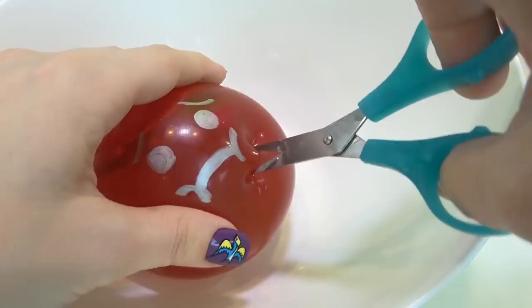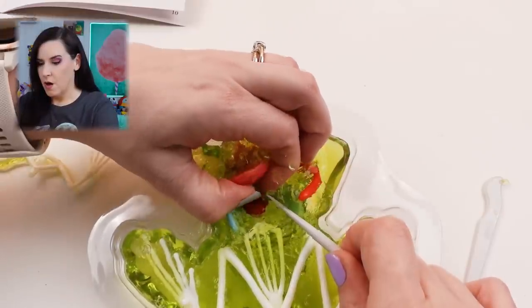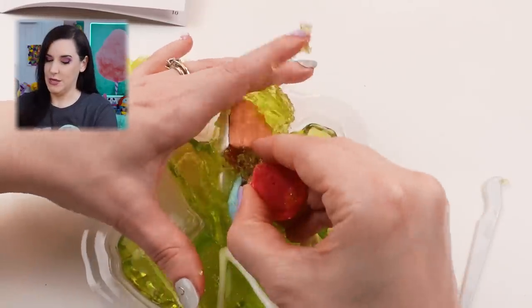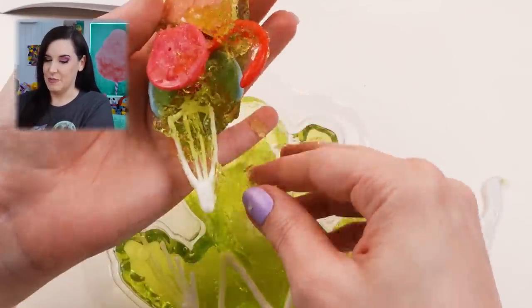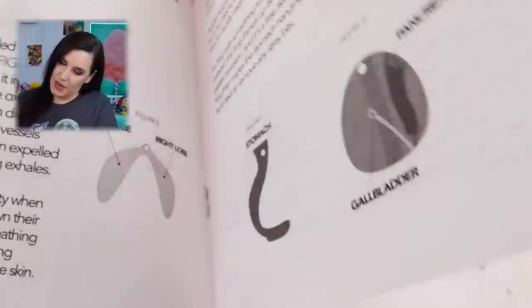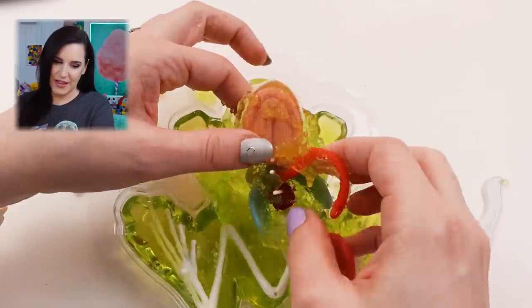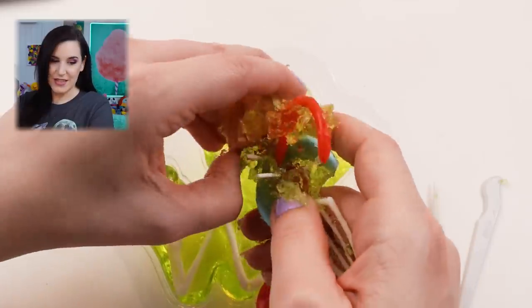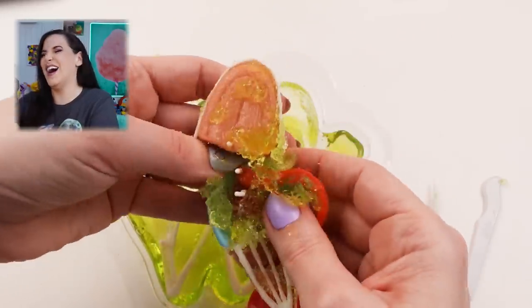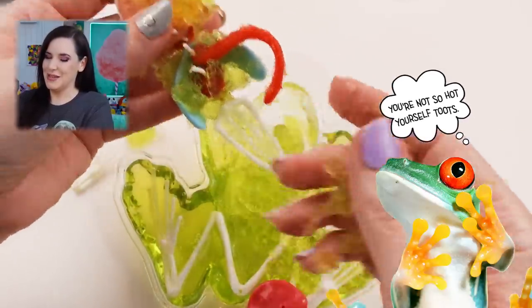What is that? Is that his tongue in there? What is this? What's this part? I'm just gonna get in there with my hands. It just came out in one big chunk. This is kind of how my 10th grade biology class went as well. Dr. Squish is not a licensed medical doctor and should not be asked for medical advice. I don't know what this part is. I think I just removed its pancreas and its gallbladder. This is supposed to be its stomach. He's got lungs here — the blue things. This wouldn't be gross or disgusting except for the fact that I'm supposed to be dissecting a frog, and so this just makes me kind of queasy.